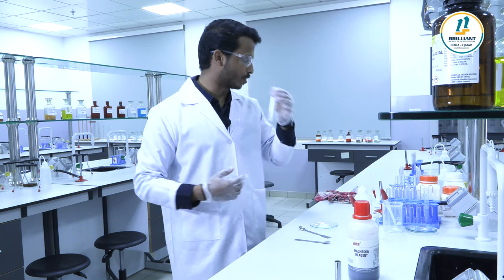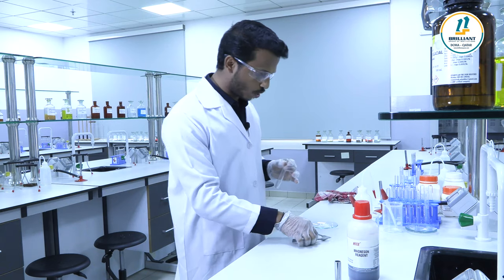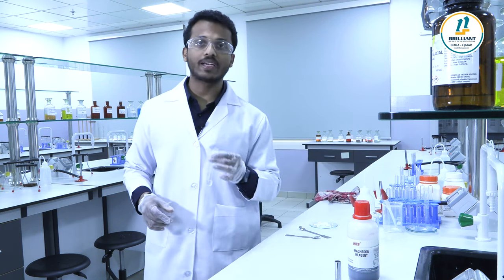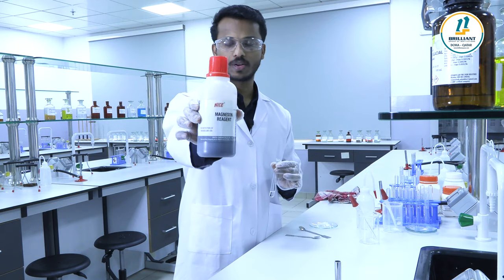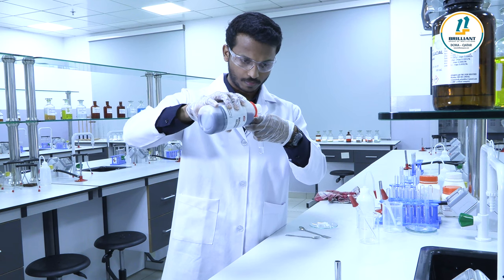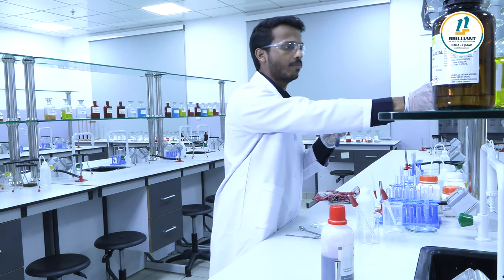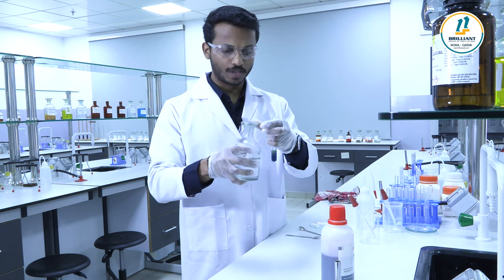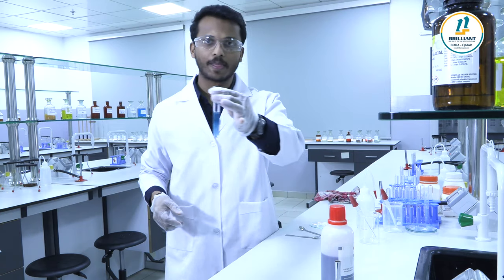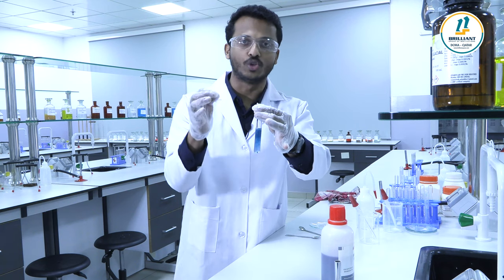Confirmatory test for magnesium is very simple. To a little of salt solution, add Magneson reagent and then sodium hydroxide NaOH solution. You will get a blue colored precipitate. If you get a blue colored precipitate, it confirms the given salt contains group six cation, Mg2+ magnesium.